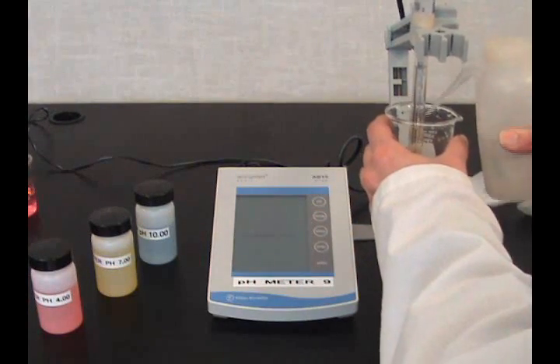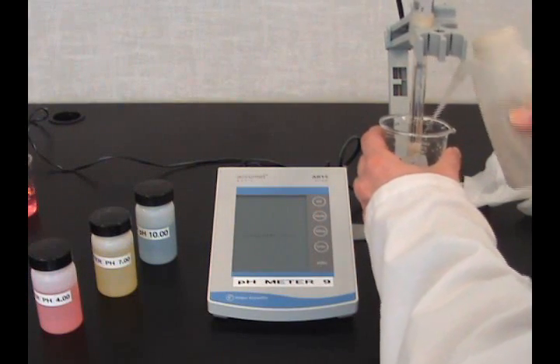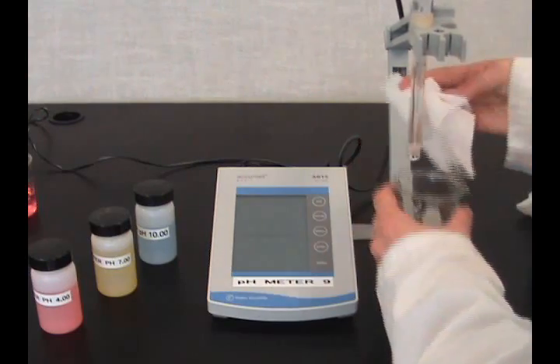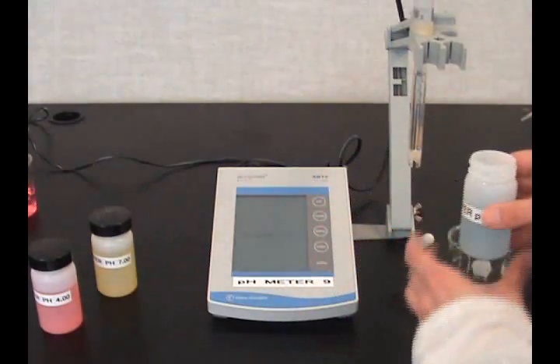Remember to rinse the probe between each solution. Do this for 10 as well.